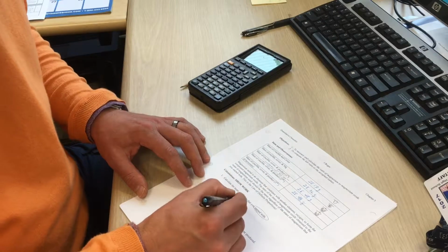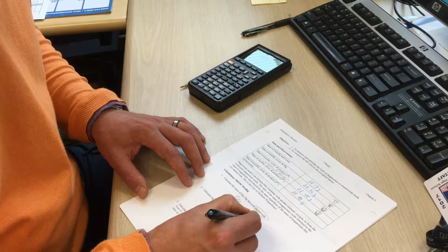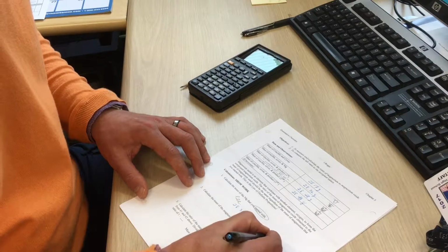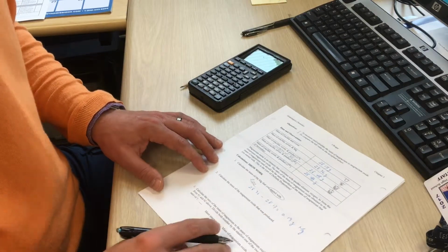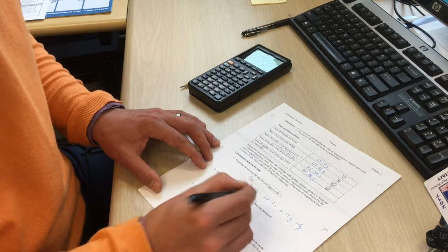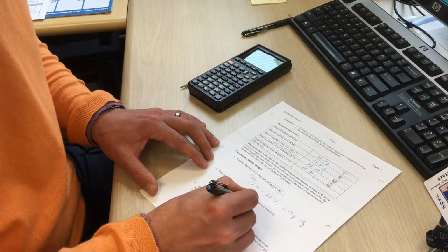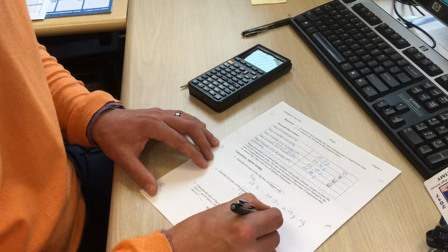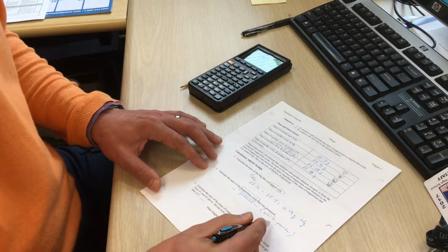If we subtract these two numbers, we get the mass of the magnesium that we started with. Then the magnesium oxide is our product. This is the white powder that we had at the end.